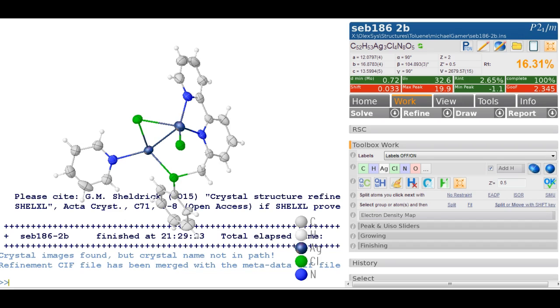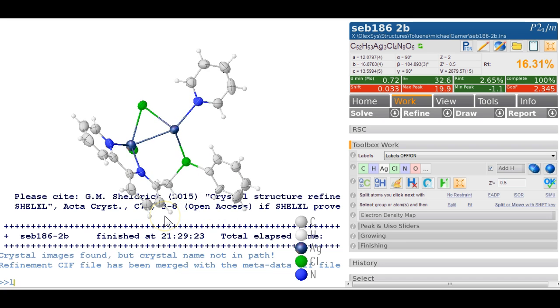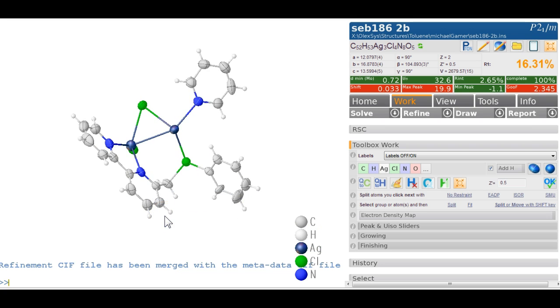Here's a nice and tricky one that I've been sent today, courtesy of Michael in Karlsruhe. Okay, this is the molecule. It looks all fine. Let's hide the text in the background. Just two lines, so we see something happens, but it isn't in the way. This thing we don't want either, so we hide it.